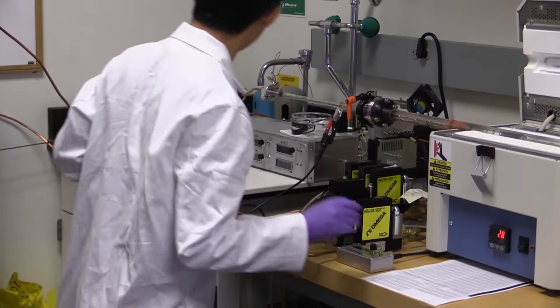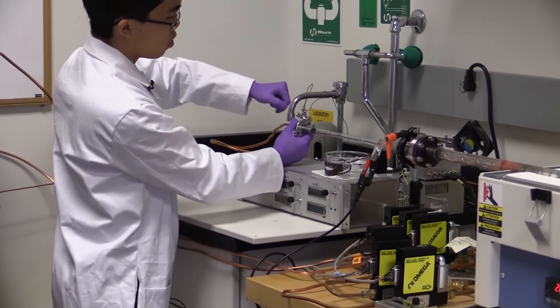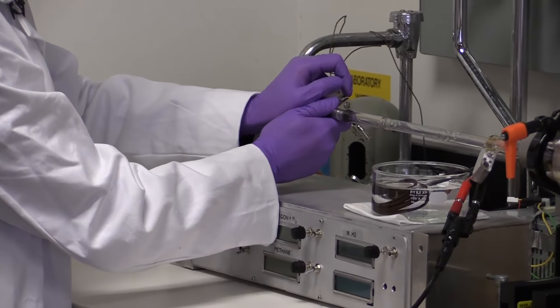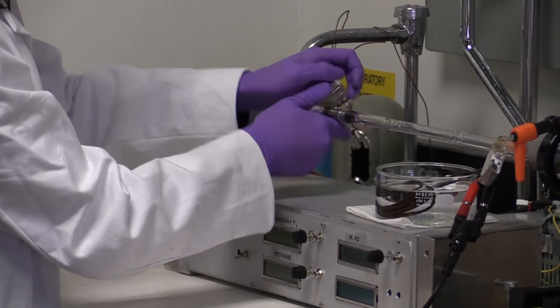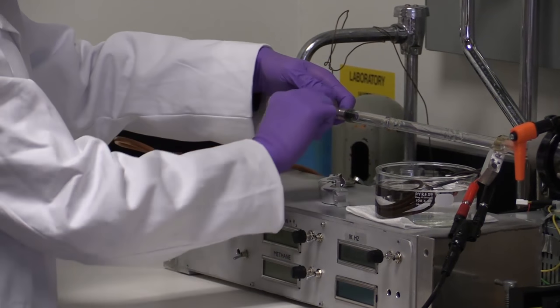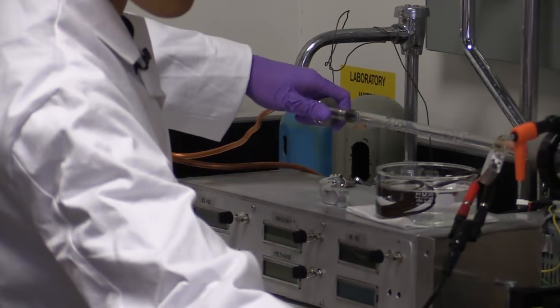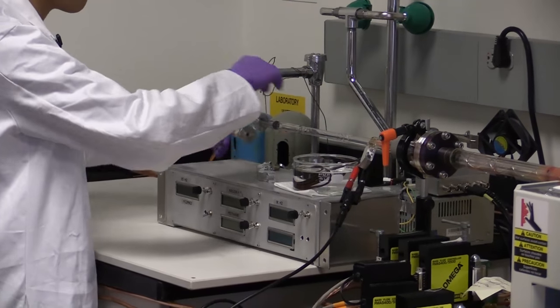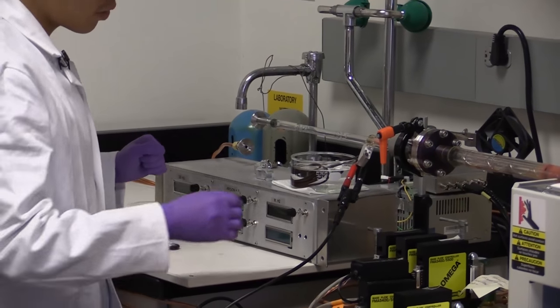That seems good. Just increase this a little bit. That's fine. Great. And now we just do everything in reverse. I'll go ahead and undo the connection. There we go.